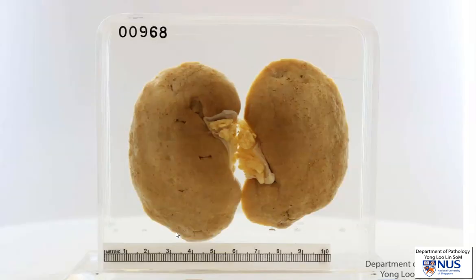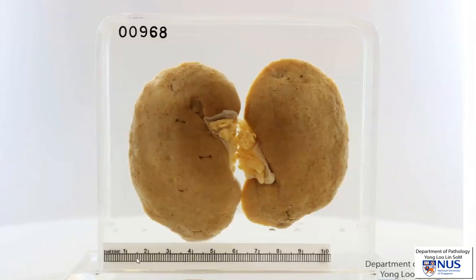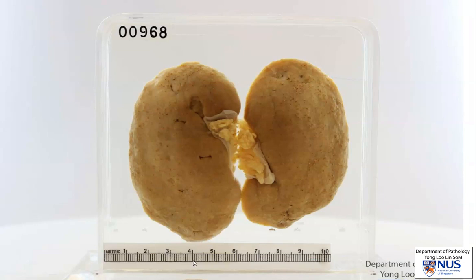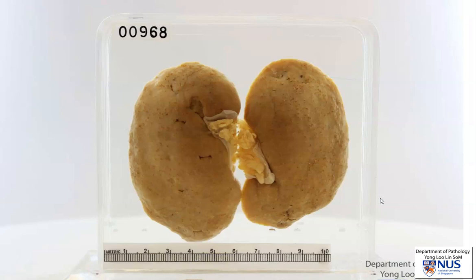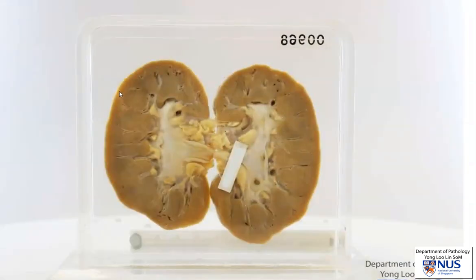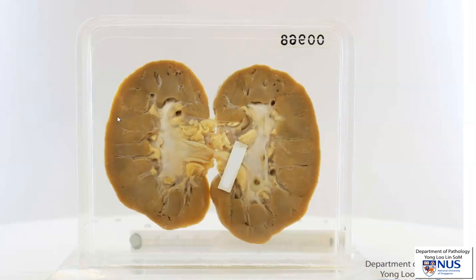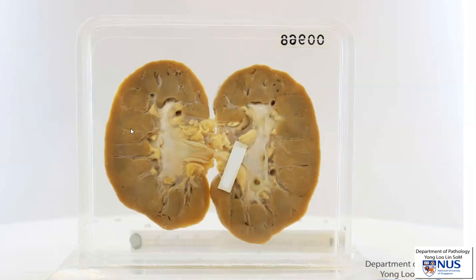If you look at the size of the kidney, the width is actually smaller than normal. In this instance, it's around 4 to 4.5 cm. The cut surface shows a thinned renal cortex and some blurring of the corticomedullary junction.